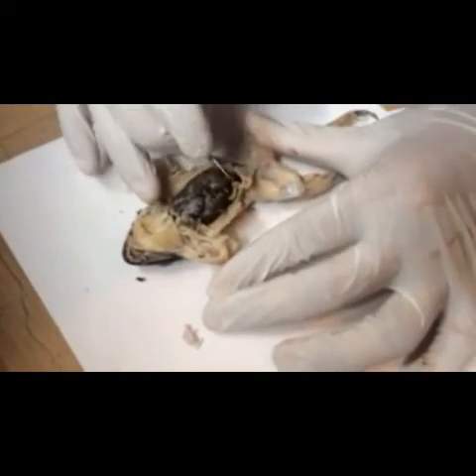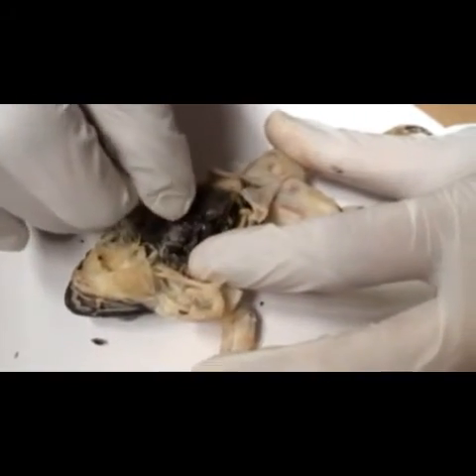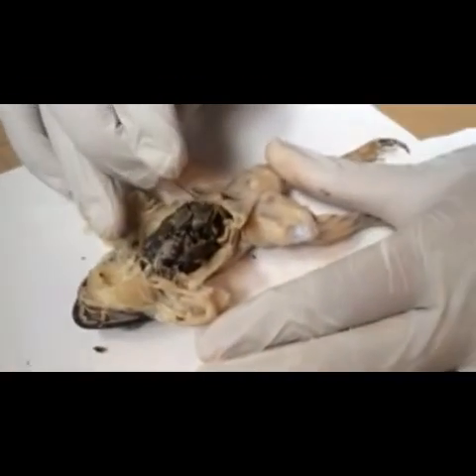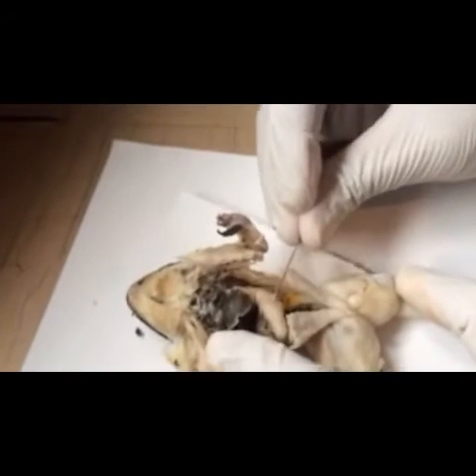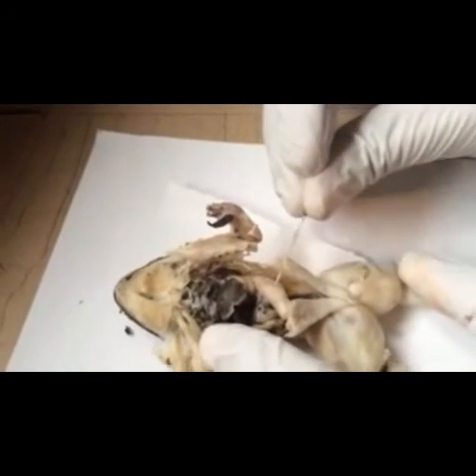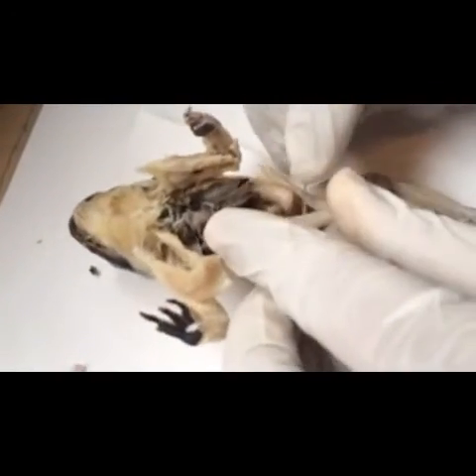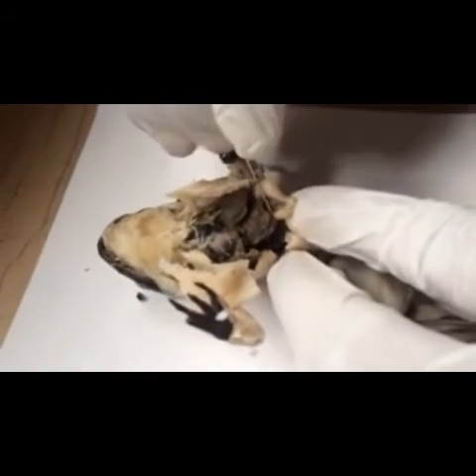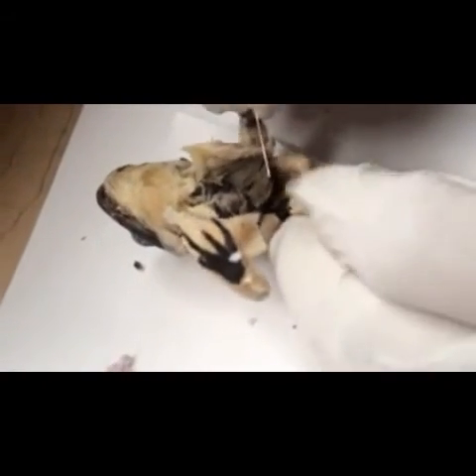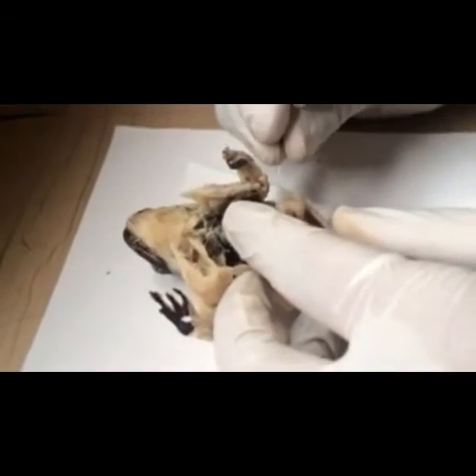So we will proceed to the gallbladder — here is the gallbladder. And then we will go to the stomach. Here is the stomach. The parts of the stomach: this is the greater curvature and lesser curvature. And then this is the pyloric constriction here. In the pyloric constriction there is the duodenum, which is attached to the pyloric constriction.